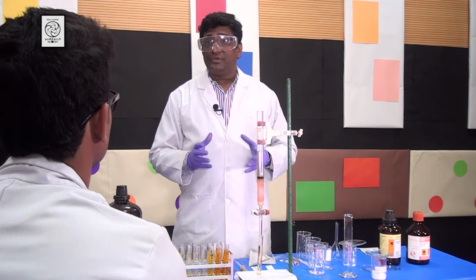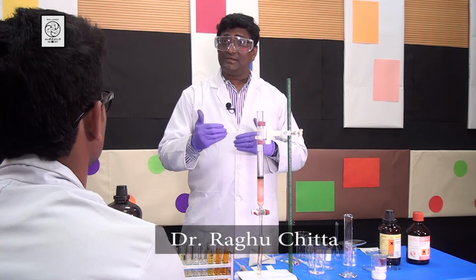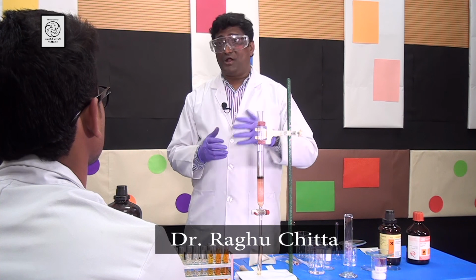Well done, students, you have understood the concepts of column chromatography. Now it's your turn to use this technique on new compounds.